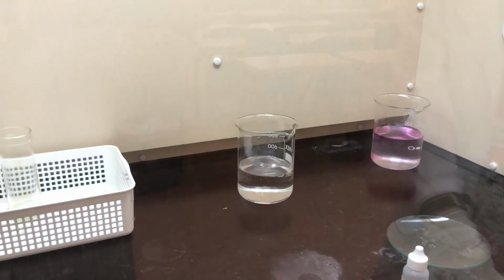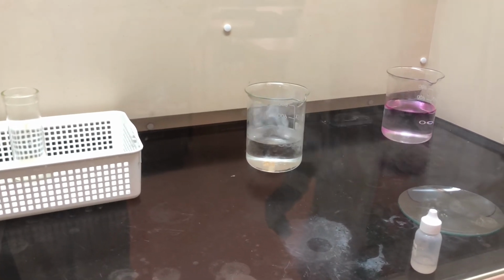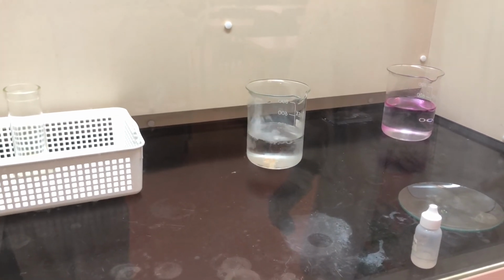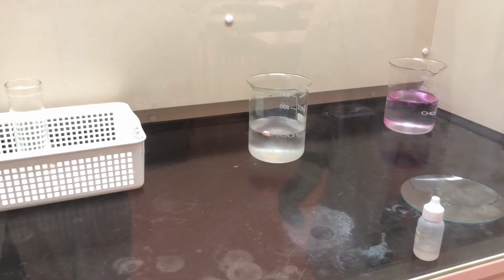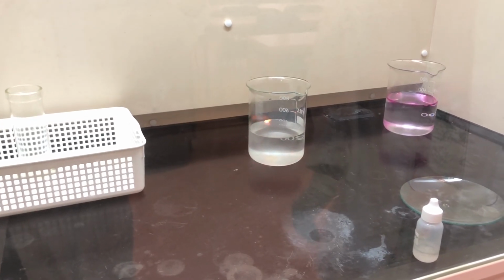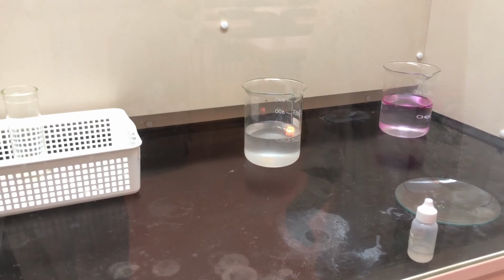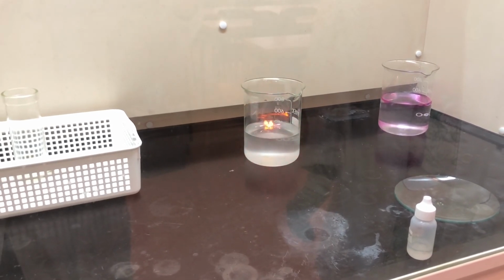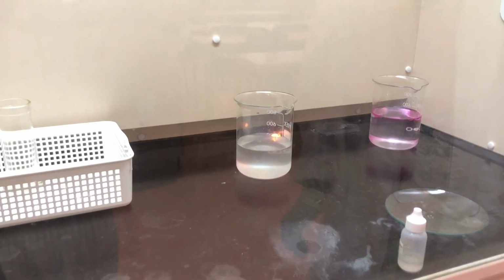And we're seeing the reaction now. Okay, so look at that characteristic colour of that flame too. That sodium colour is really characteristic, and you'll see that again when we start doing flame tests, okay? So you can just see how reactive it really is. And it's going to take a while to actually burn out.